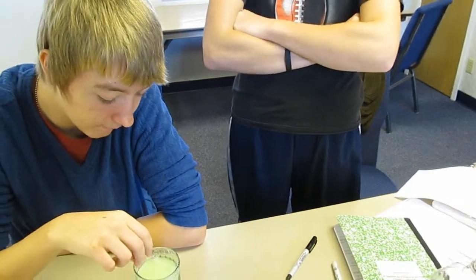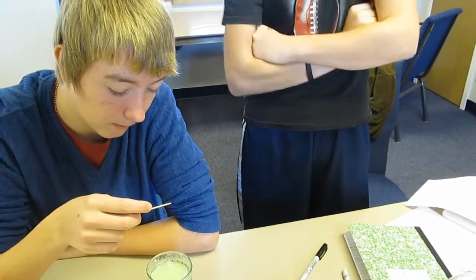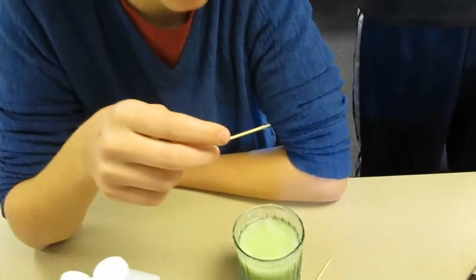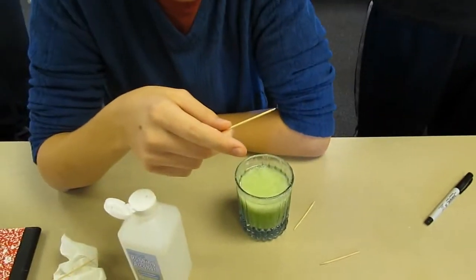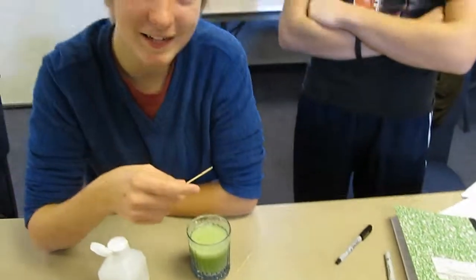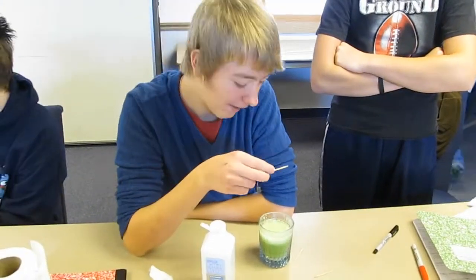Mine is really beautiful. It's not foam. I've got drops of water all over this thing. It's not a string. It is a string — it wrapped around like quite a few times. Now what are you supposed to do? I don't know. You've got a problem with my DNA. Yes, I do. At least with your pea DNA. Your split pea DNA.